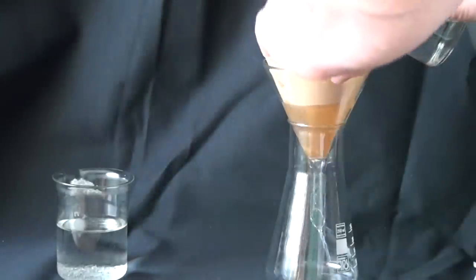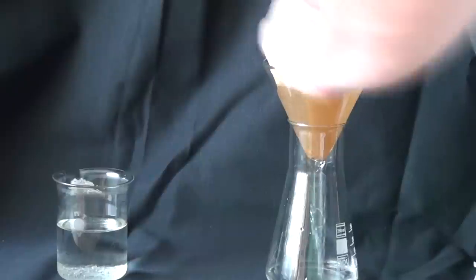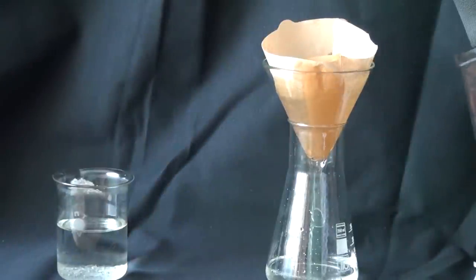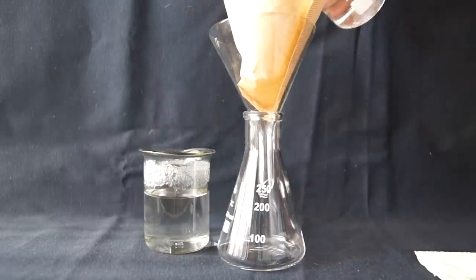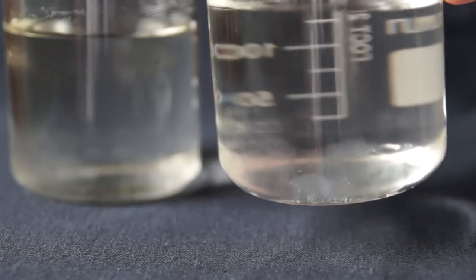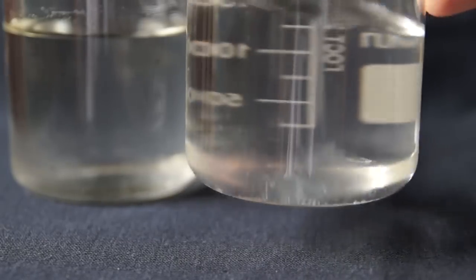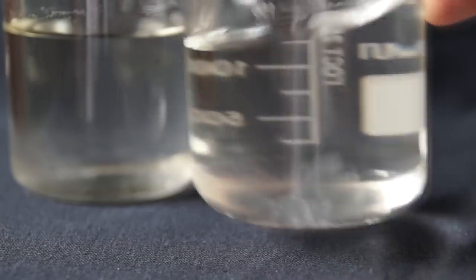Also, once a month or once every two weeks, I recommend filtering the solution to maintain its clearness. Over time, in the solution some specks or other dirt might occur, which can screw up the crystal.